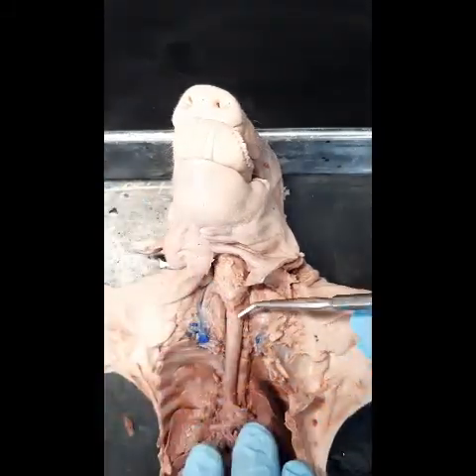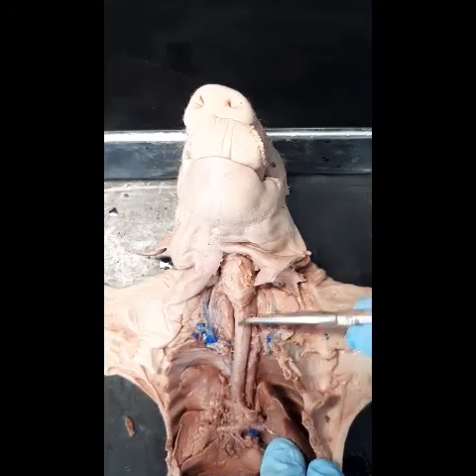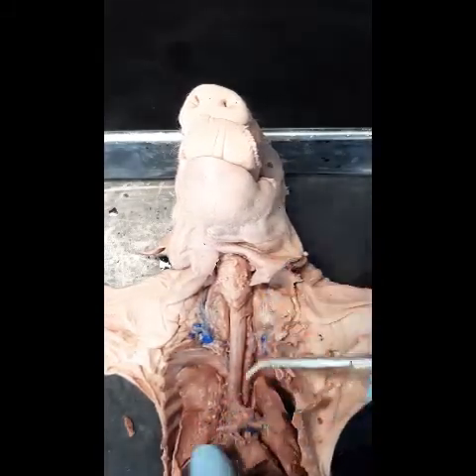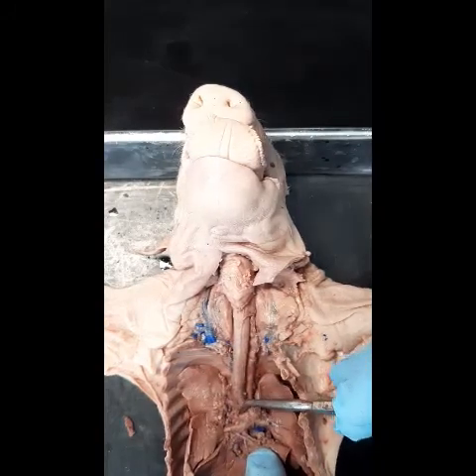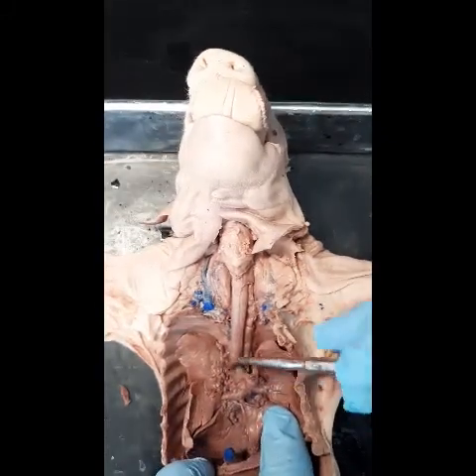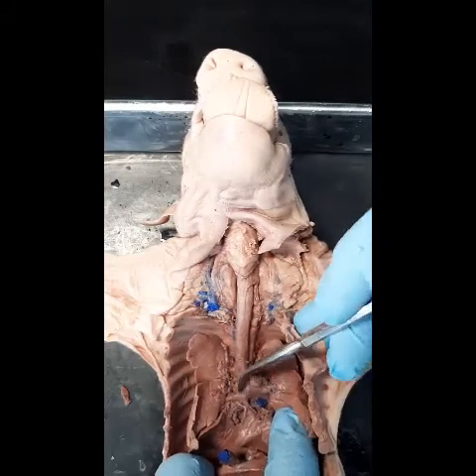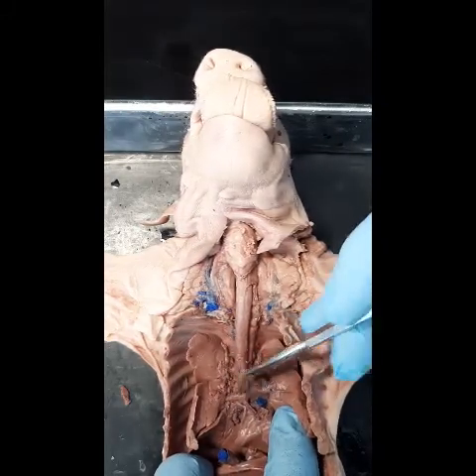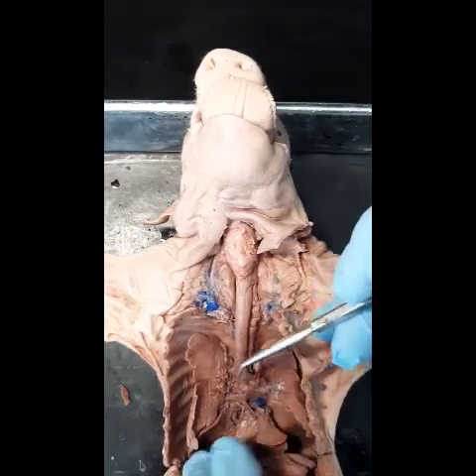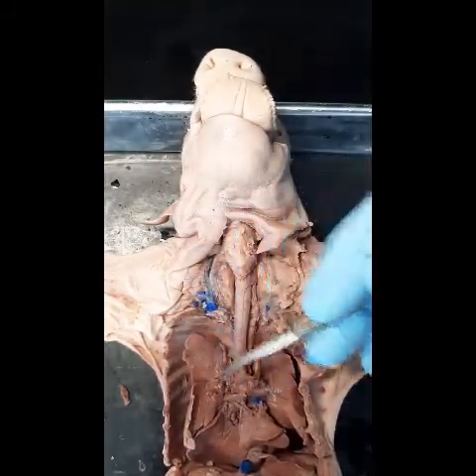We have the trachea, and you can see the several cartilaginous rings. The trachea goes all the way down. The heart has been removed to expose the lungs, and from the trachea it eventually gives rise to branches called bronchi. In the fetal pig you have three bronchi: the apical and the two primary bronchi. Each one leads into the left, right, or the apical portion of the lung.